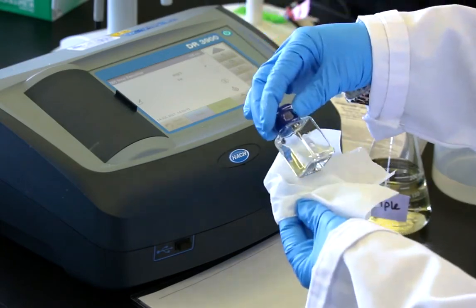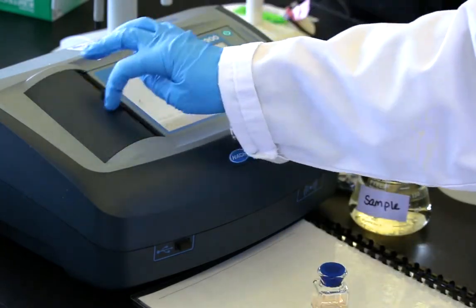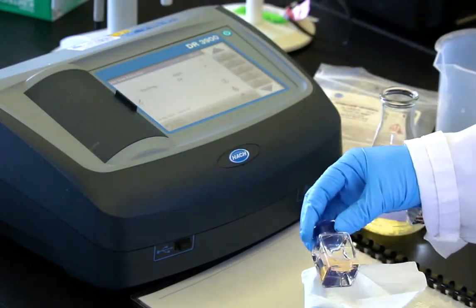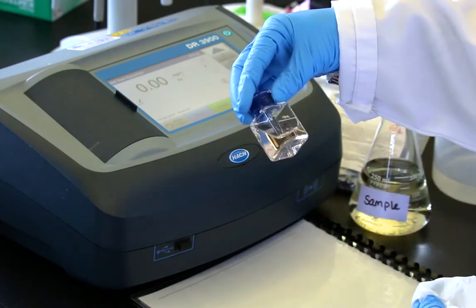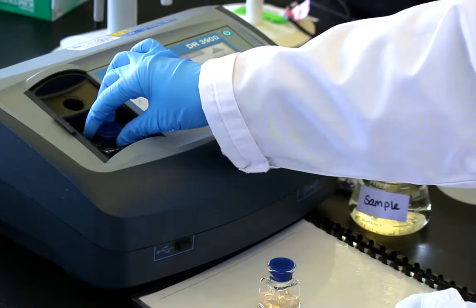In the meantime, clean the outside of the blank cell filled with the sample water and align it in the instrument as indicated by your manufacturer. Zero the instrument and remove the blank cell.